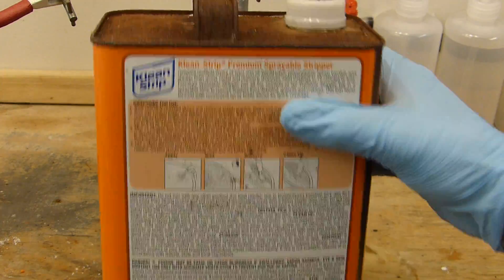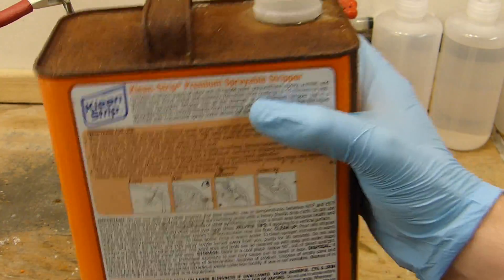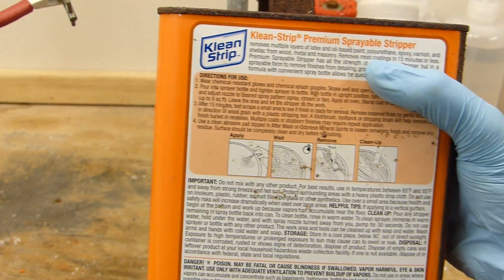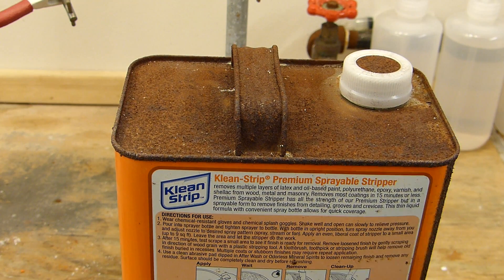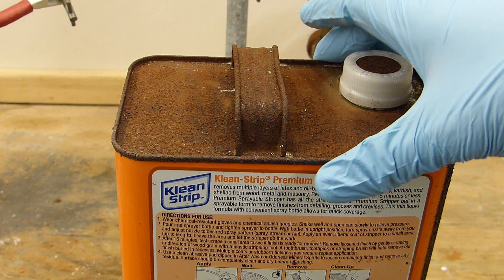There's some polymeric goop in there which makes it this sloppy gooey stuff. So we're going to try today and distill the dichloromethane or isolate the dichloromethane from this paint stripper.